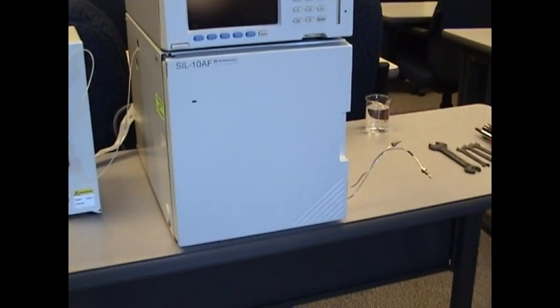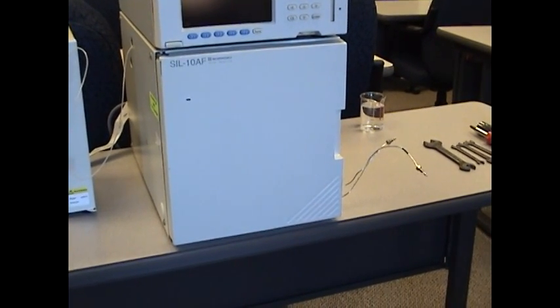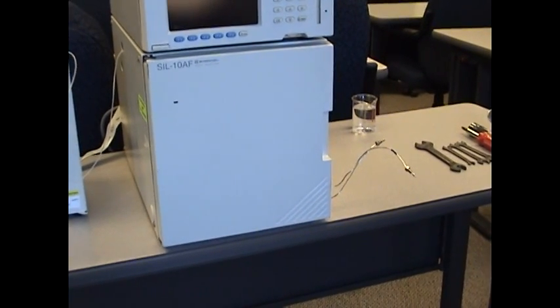Hello, this is another installment of the video series for HPLC, Shimadzu HPLC users and operators.